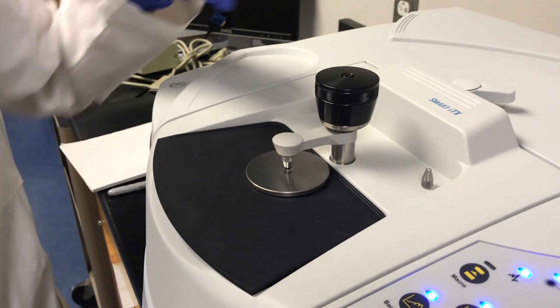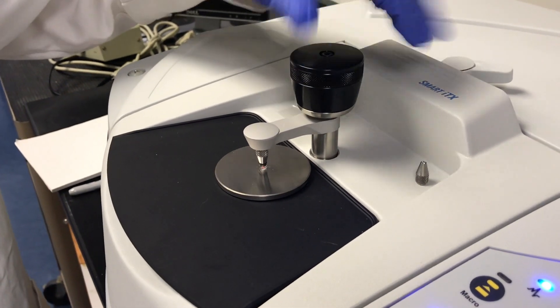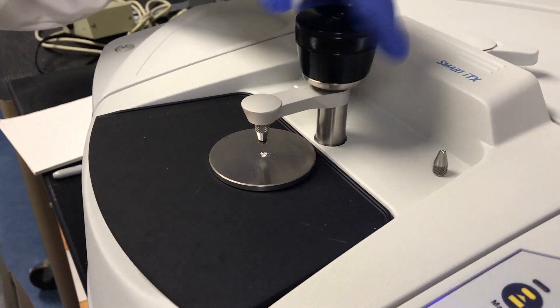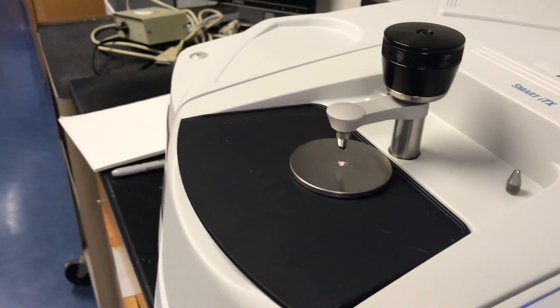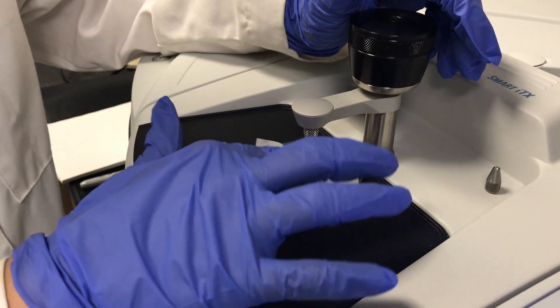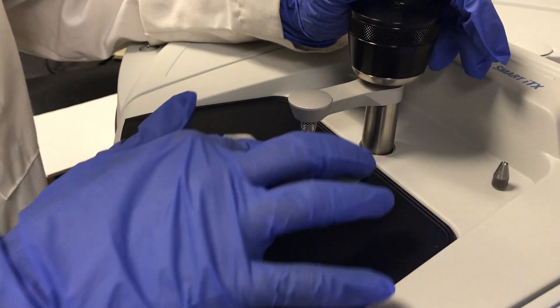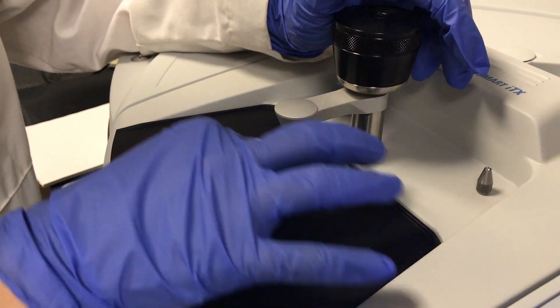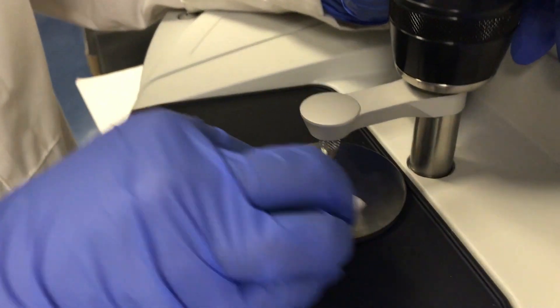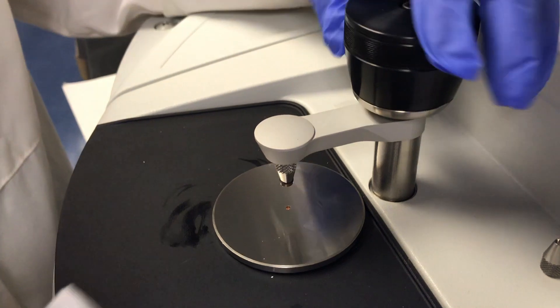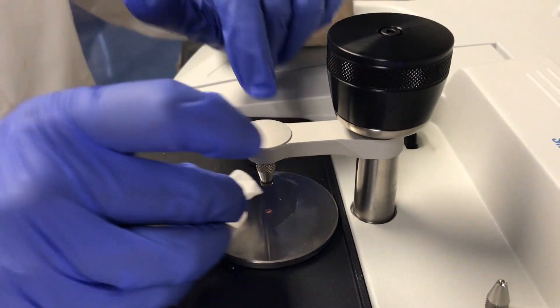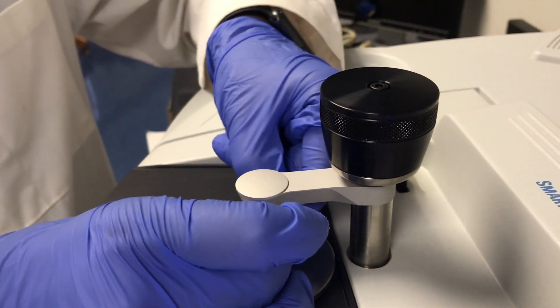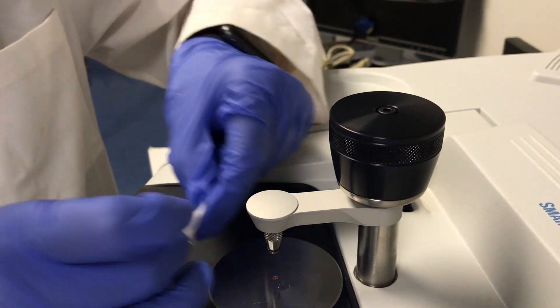Now that you're done running your sample, you can turn this knob and make sure that you clean up after you're done. You want to make sure you clean the crystal and get all of the powder off. And then you want to make sure that you clean the bottom of this accessory or else some of the sample will stay on for the next one.